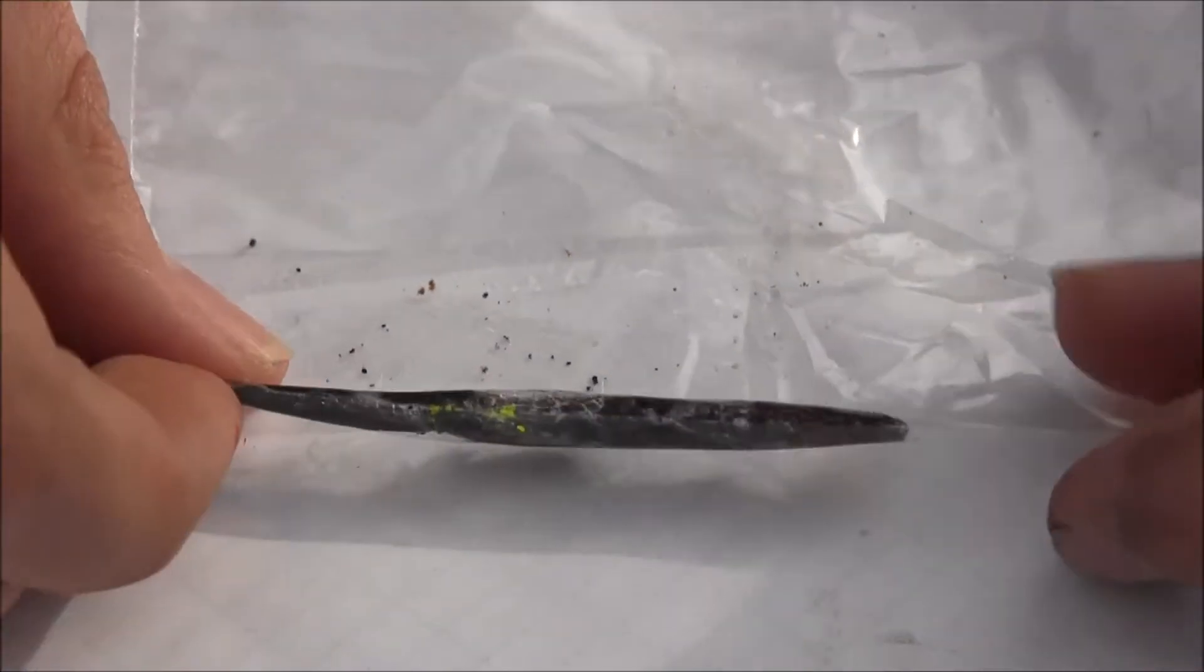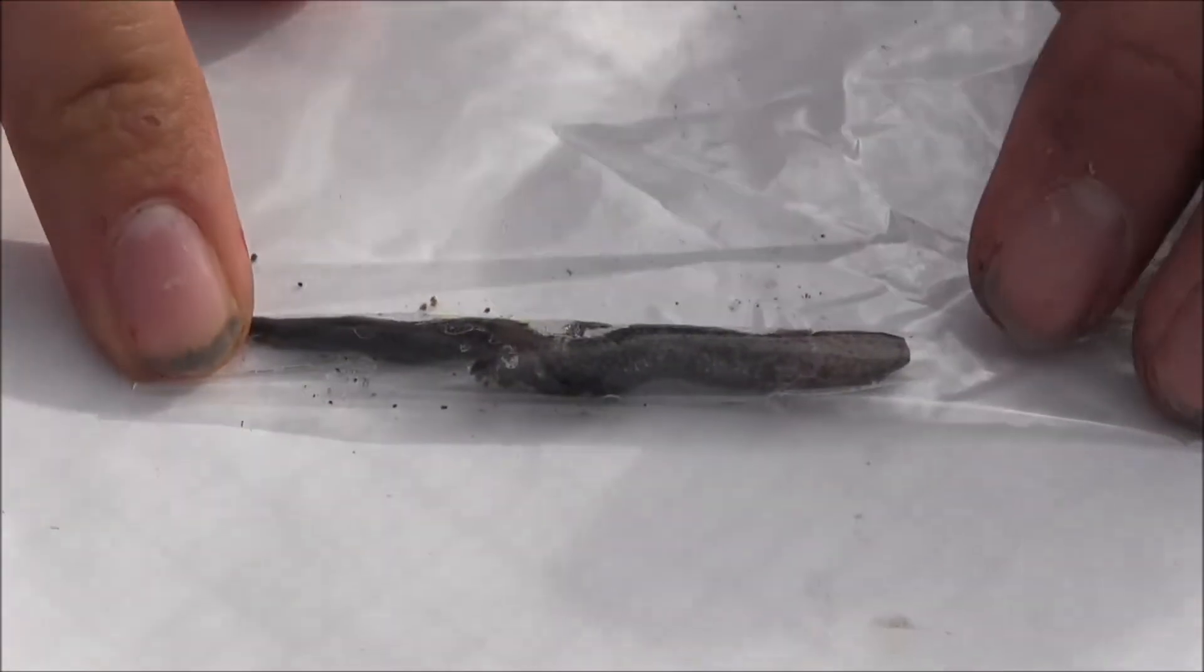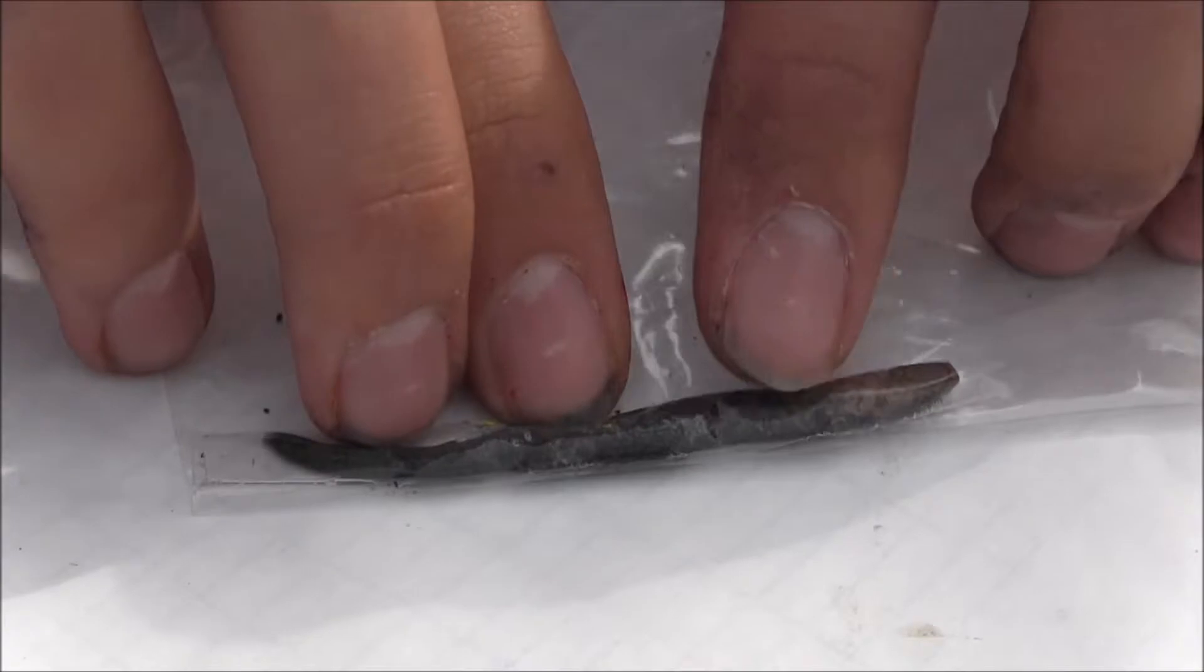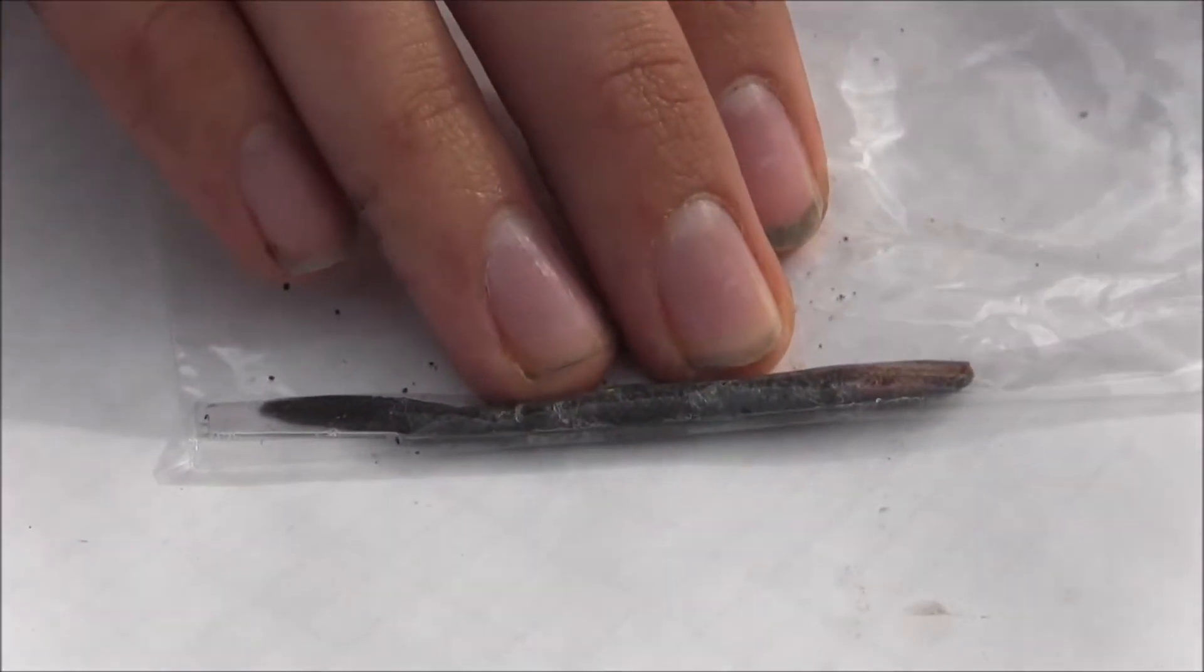To mark the second and third position, what I usually do is I will flip over this bag. So that way, position two and three are exposed. This is really convenient instead of having to try and scoot them around.